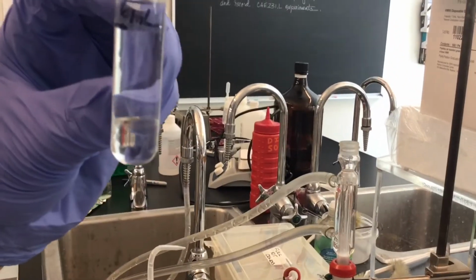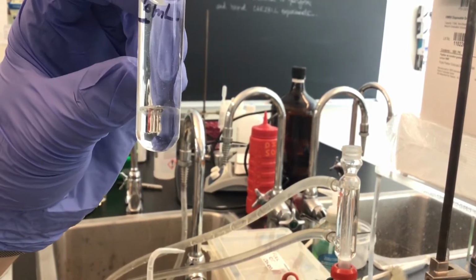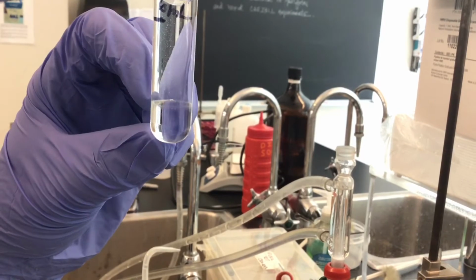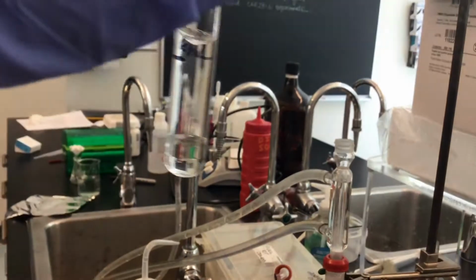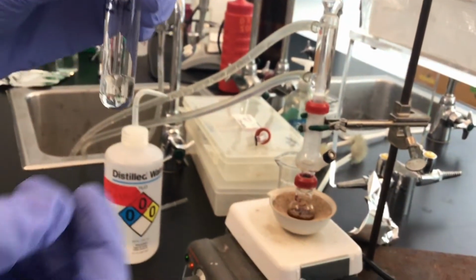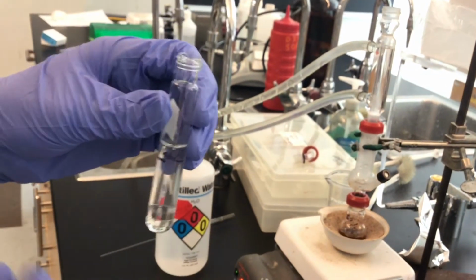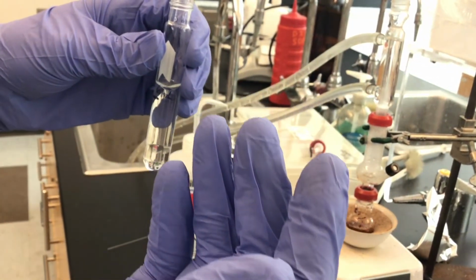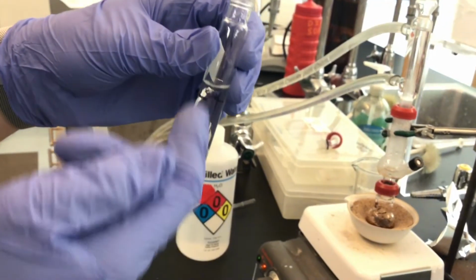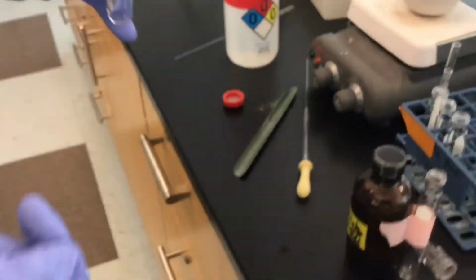We've got the top aqueous phase and the lower organic phase. Also, we can say this is the top aqueous layer and the lower organic layer. And so we want to gently shake this in order for the 2 to mix again and try and extract out as much cinnamaldehyde as it can into the first organic wash, we can call it, of the extraction procedure. So I need a little screw cap.